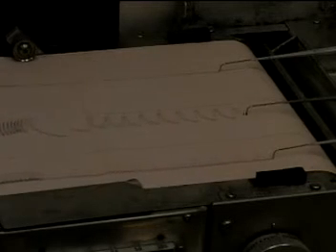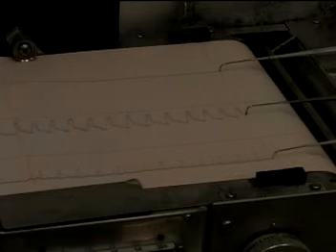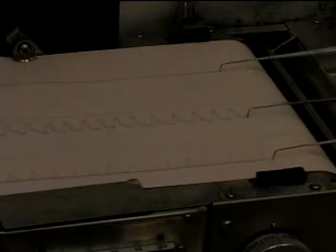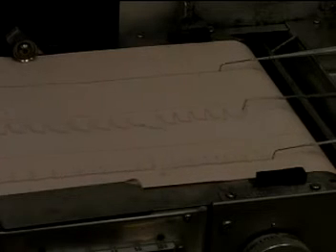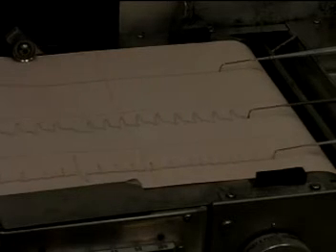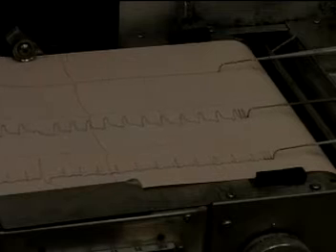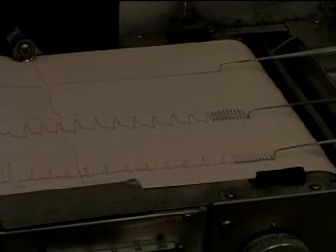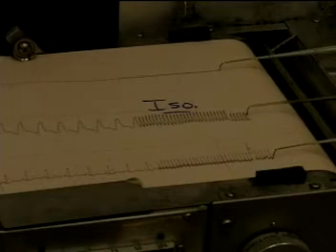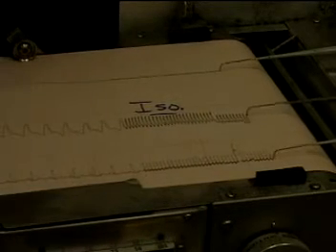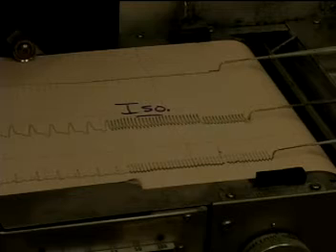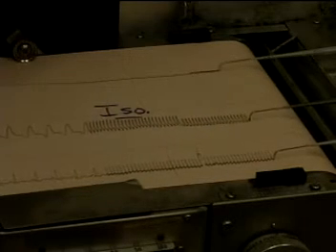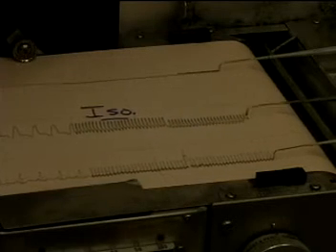A feature you can see here on the blood pressure waveform on the descending pressure pulse, that's the dicrotic notch where the valves close. We're now injecting isoproterenol.